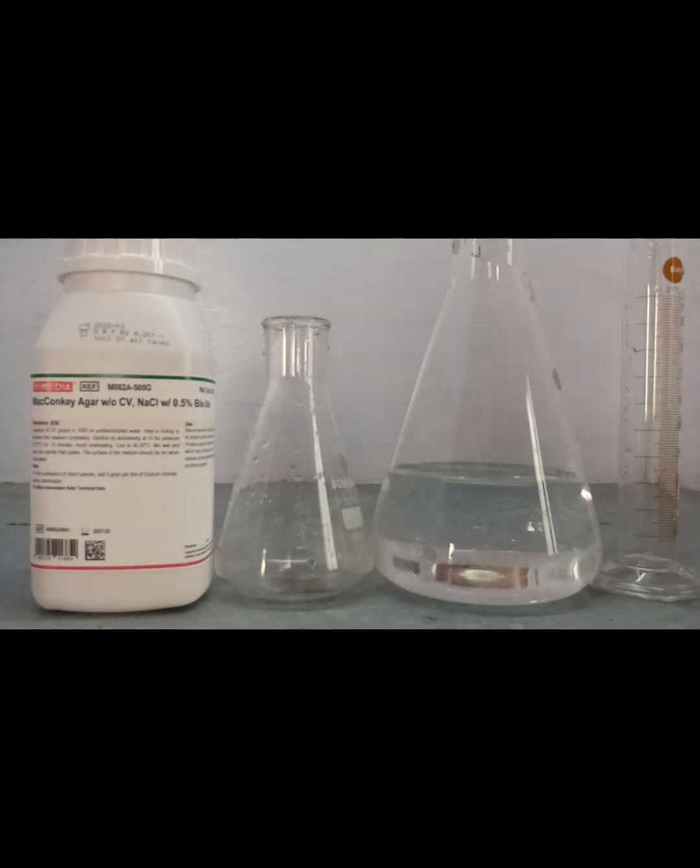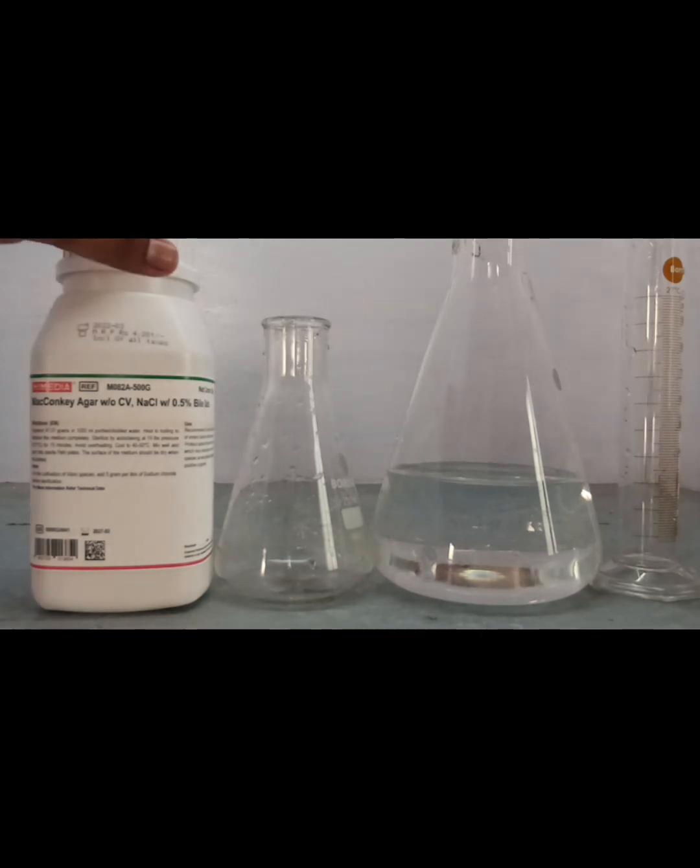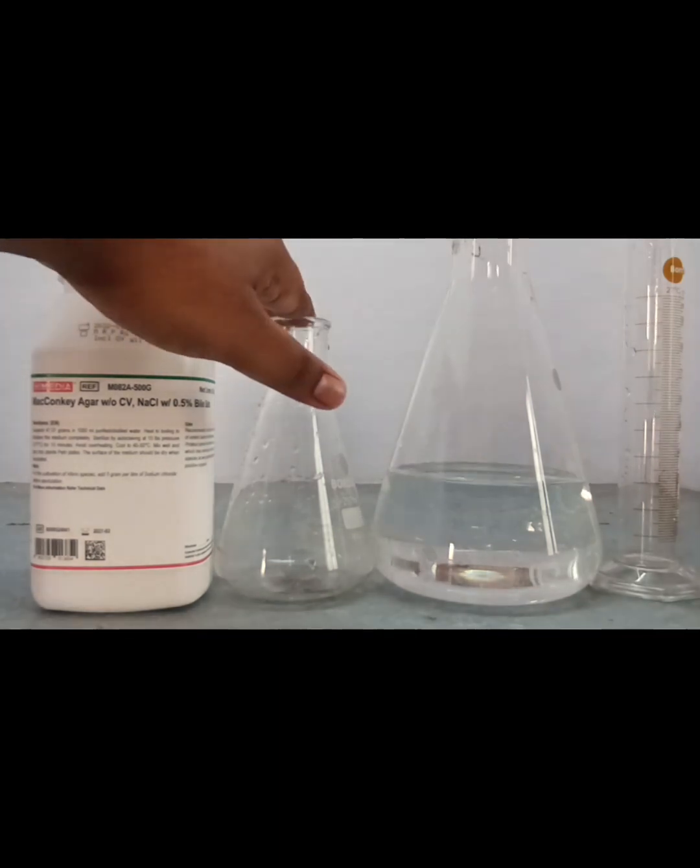For the preparation of MacConkey agar, we need MacConkey agar powder, a conical flask, a measuring cylinder, and distilled water.